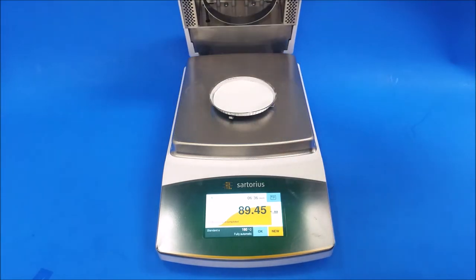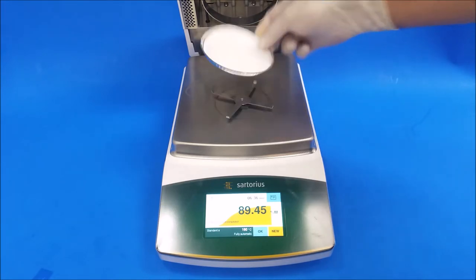And if you're going to run another test, just remember to dispose of this. Don't reuse this.